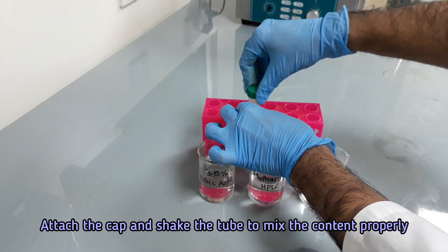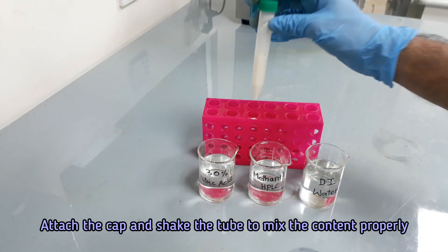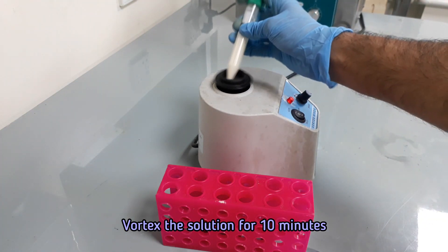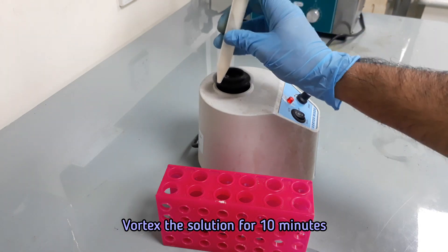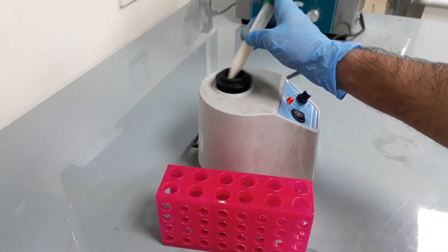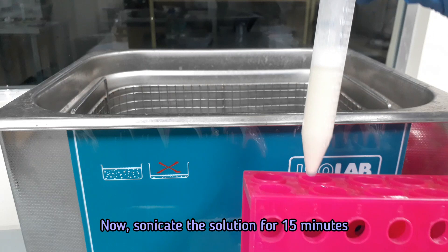Add deionized water. Vortex the solution for 10 minutes. Sonicate the solution for 15 minutes.